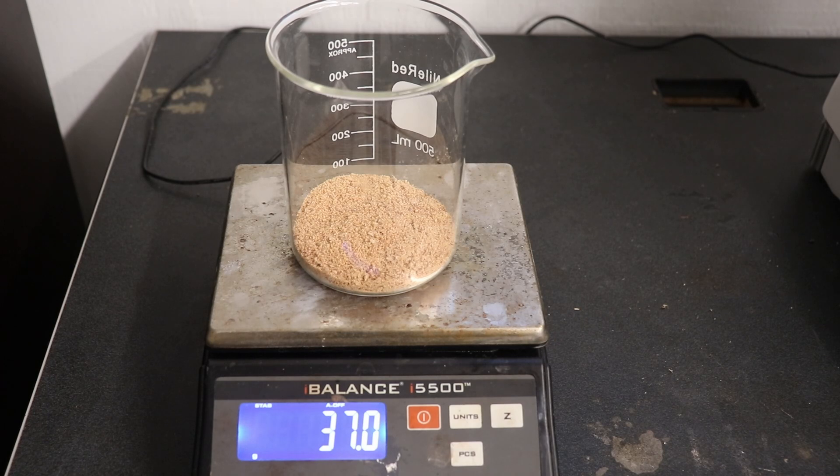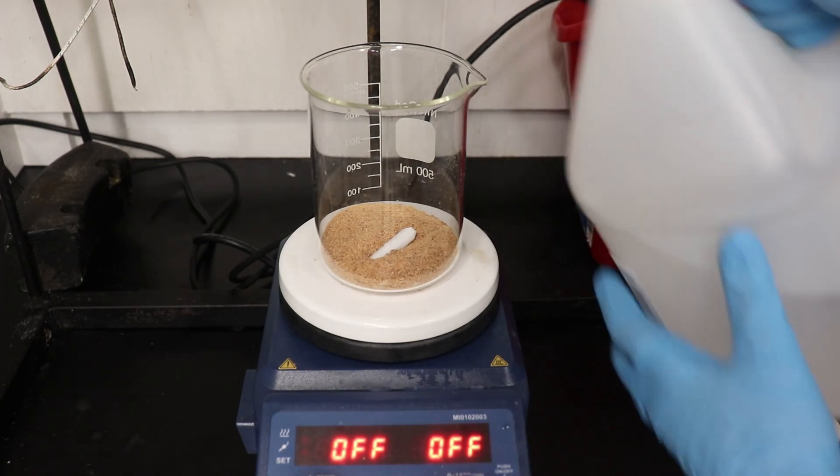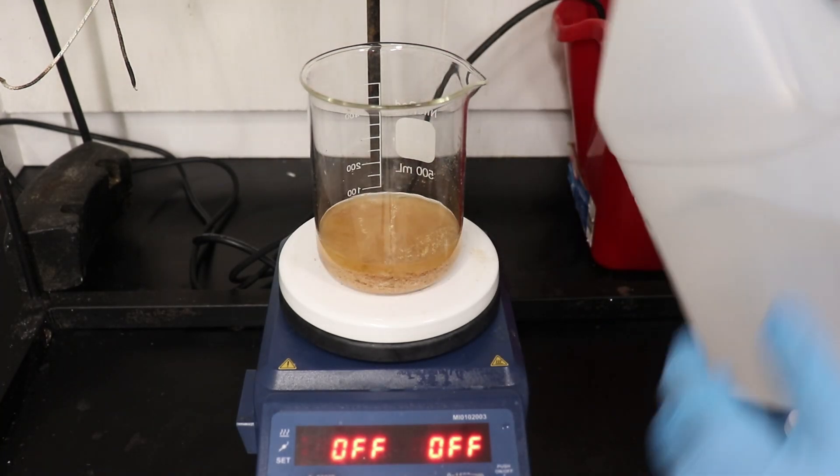The crude yield was 37 grams, which is 93.6%, but we still need to do a recrystallization to improve the purity of our product.